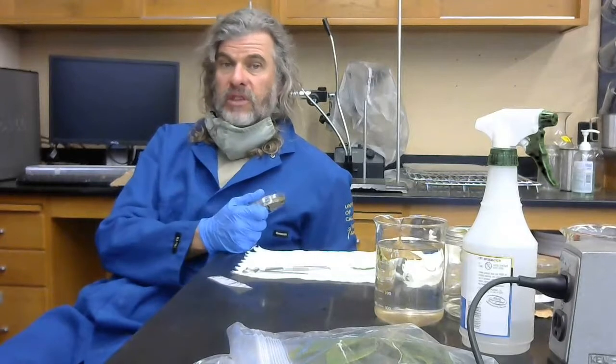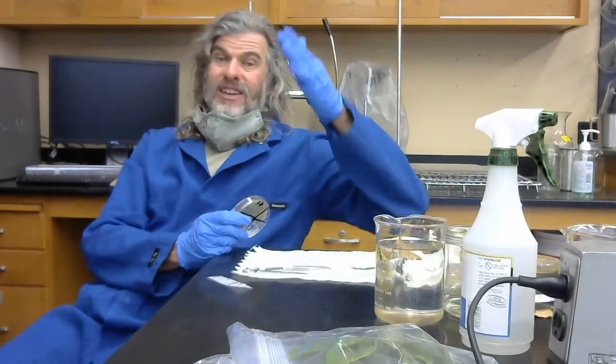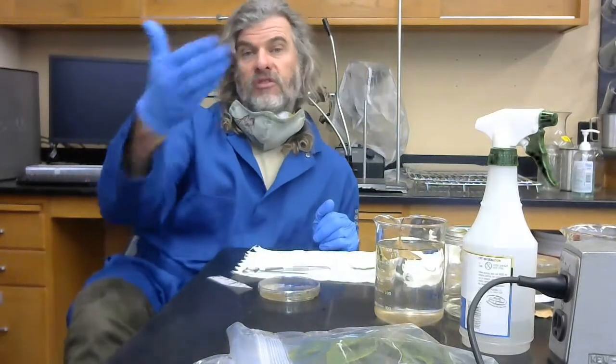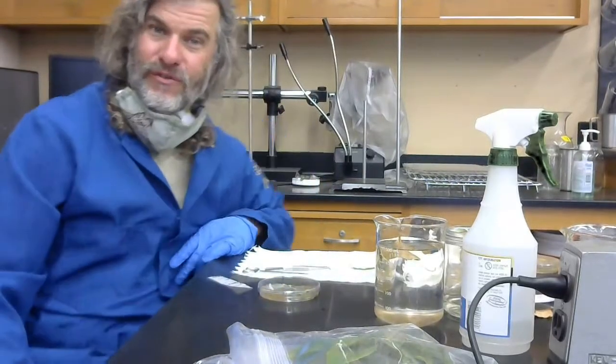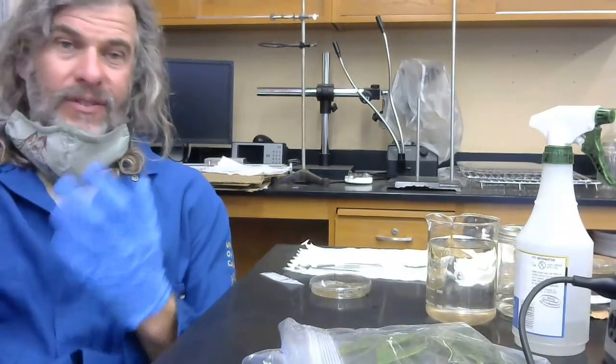For the most part, those are the ones that are going to grow out in the time period of this particular study that we're going to do. So get the material into the media. Don't put it on top of the media, saw into the media and get it in there. The other thing that can go wrong here is if you cut your pieces of leaf too big. So, 2 by 2, 3 by 3 square millimeters of material is all you need, or about a hole punch. Enjoy. Really quick, fun things grow out, and I think you'll be surprised by them, and they're pretty cool to look at as well.